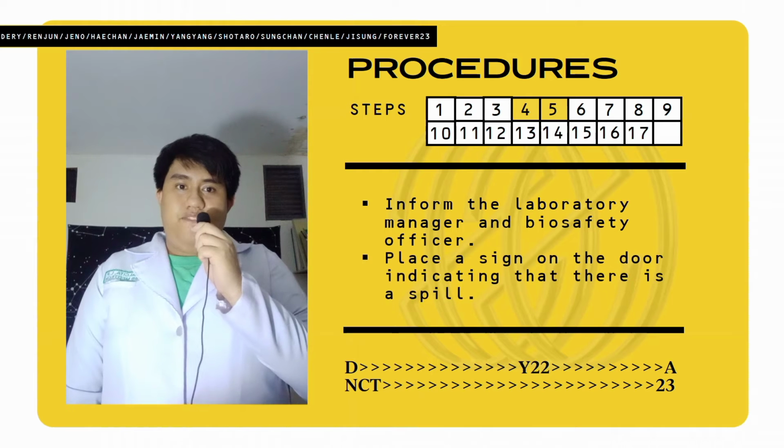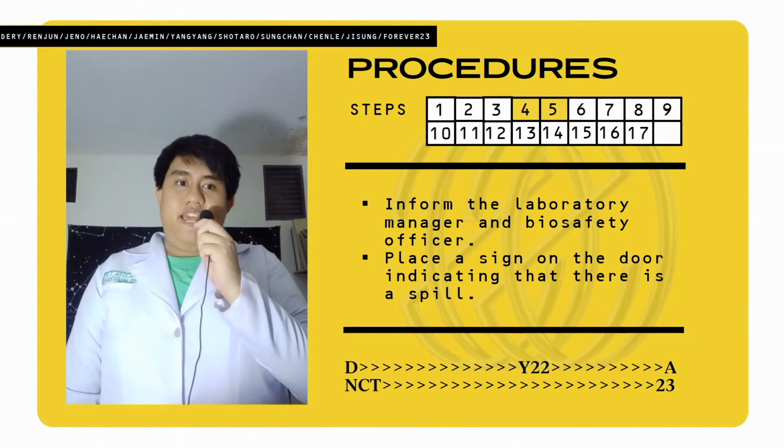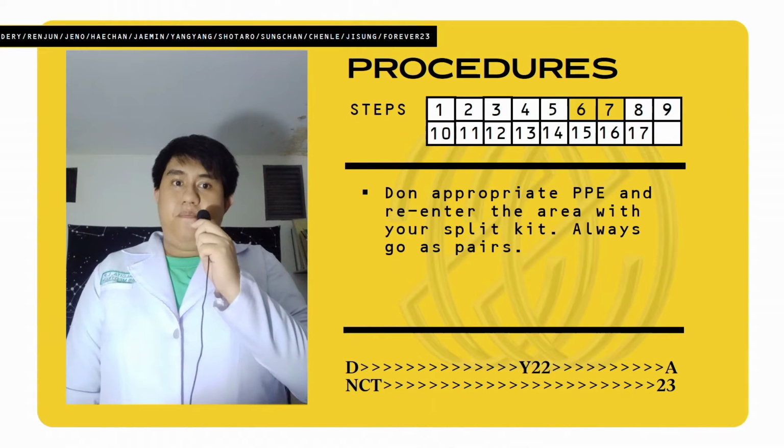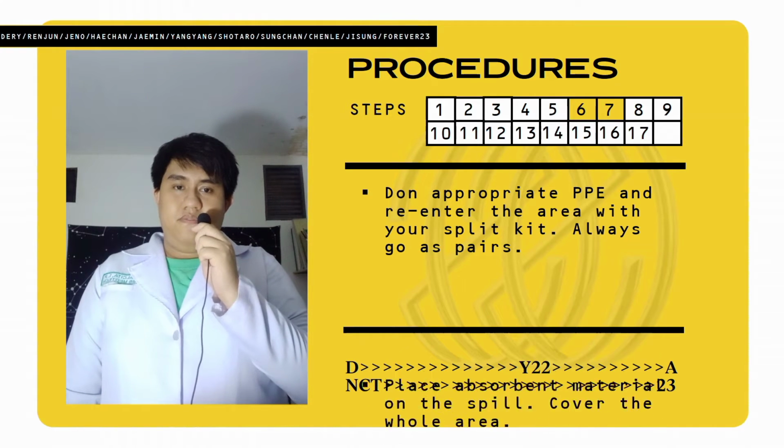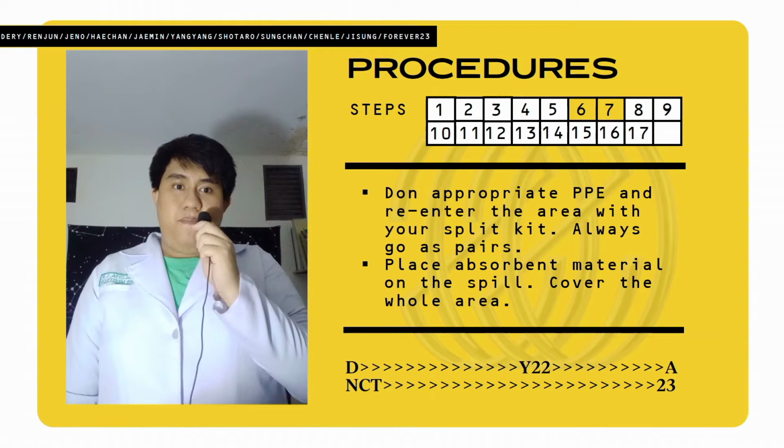And after, we have to place a sign on the door indicating that there is still a spill. Next is we have to don appropriate PPE again and re-enter the area with your spill kit. Always go as pairs. Next is we have to place absorbent material on the spill and cover the whole area.